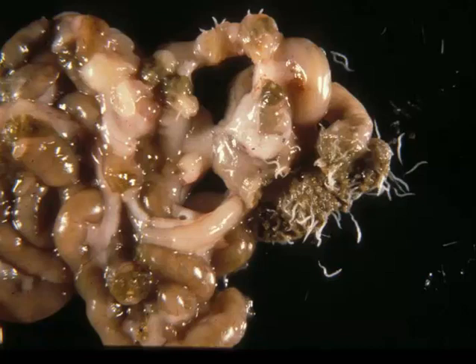There are some differences between the two. Aspiculuris ova are symmetrical, Syphacia are not. Syphacia deposits eggs around the anus, Aspiculuris does not. Both of them cause minimal or no disease in affected animals. You can see focal inflammation around areas of invasion in the mucosa in immunodeficient mice, and very rarely rectal prolapse may be attributed to heavy infections. It's most often seen in young mice, and a form of immunity appears to develop with age.